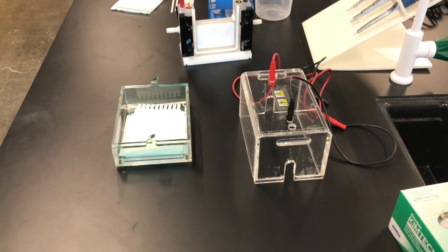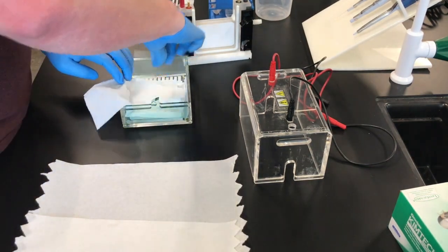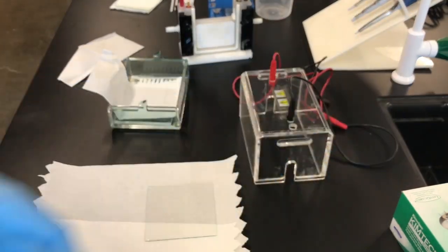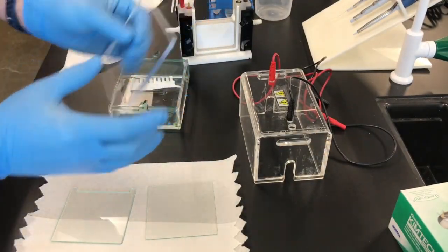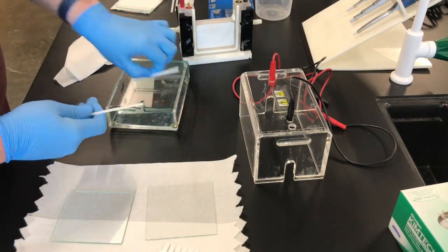Taking everything out of your bottom chamber, we're going to lay out a paper towel. There's a square glass plate, a glass plate that has little notches on it, an acrylic block, and then there's the comb and the spacers.